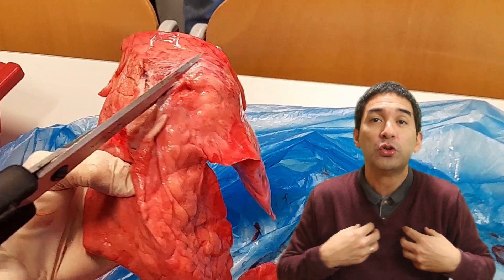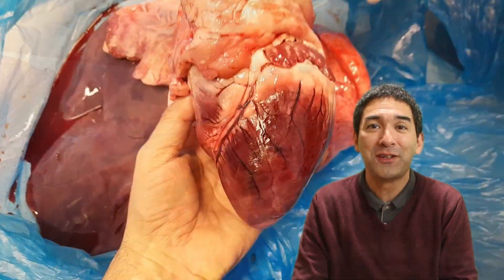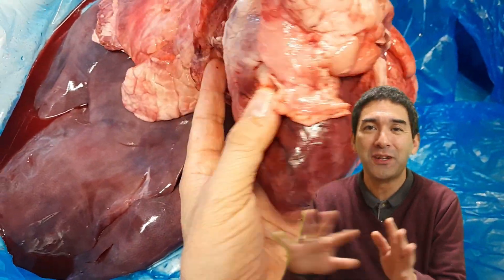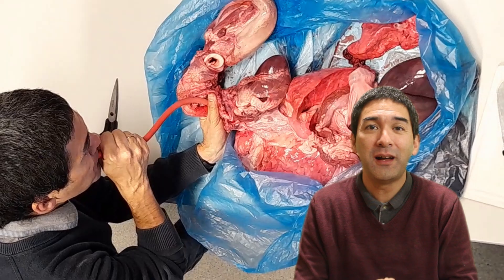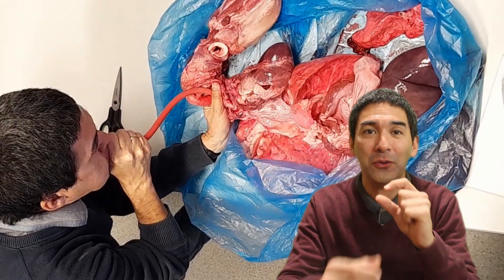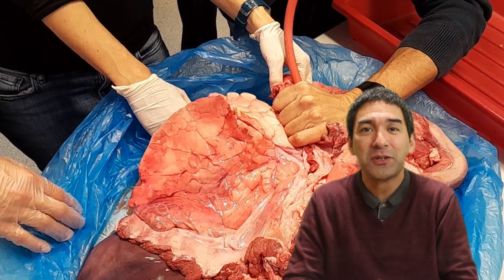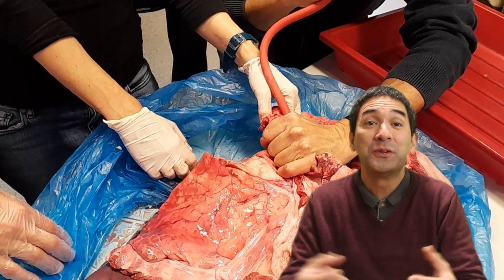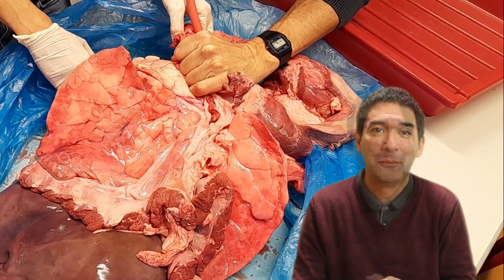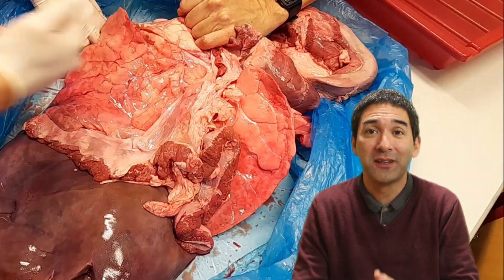The heart was still present and we also dissected it, seeing the four heart chambers. Then I took a rubber hose and blew some air into the lungs of the pig — the lungs inflated, which was a nice demonstration that the lungs contain tiny little air spaces, even if they're too small to see without a microscope.